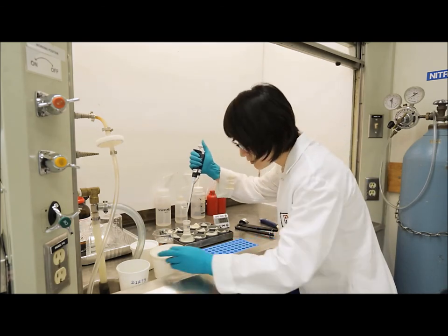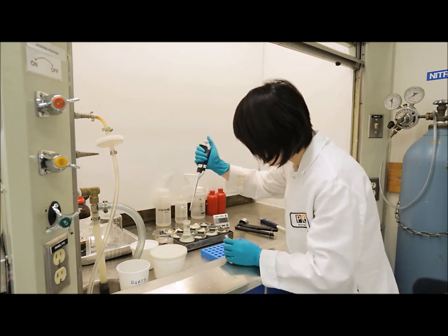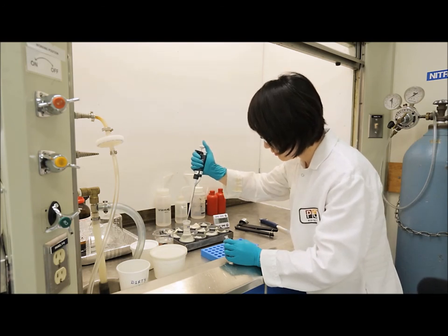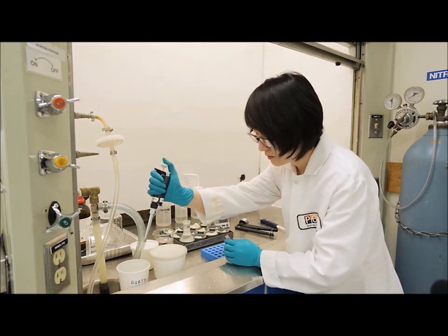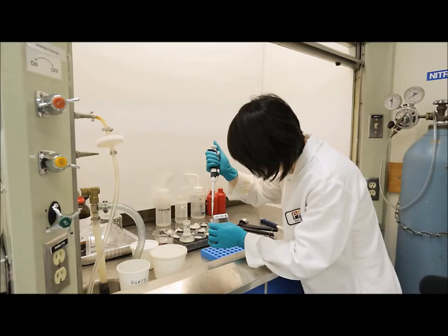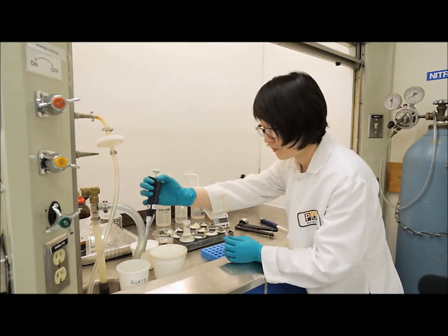When subsampling from the heptane layer, we typically rinse with the heptane layer a couple of times to ensure that we're not putting in any sort of contamination into the GC vial. The amount of microliters that you add of the heptane layer to the vial will depend on the type of sample.